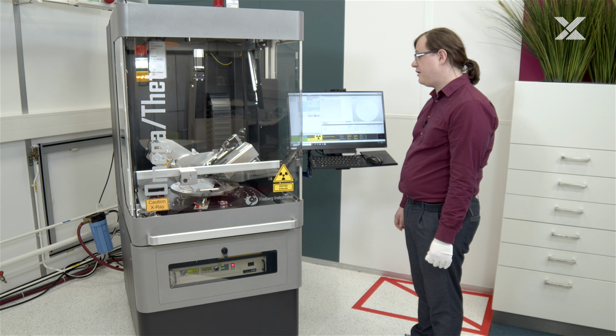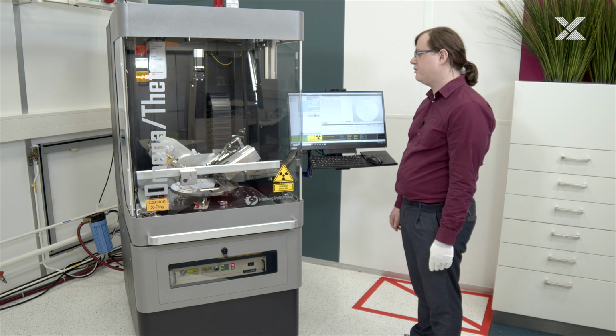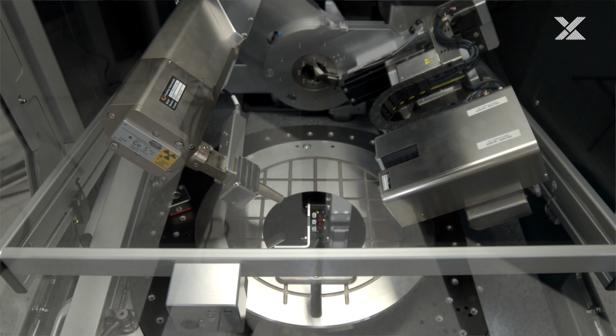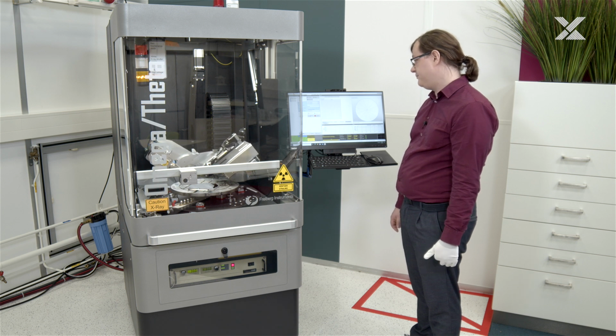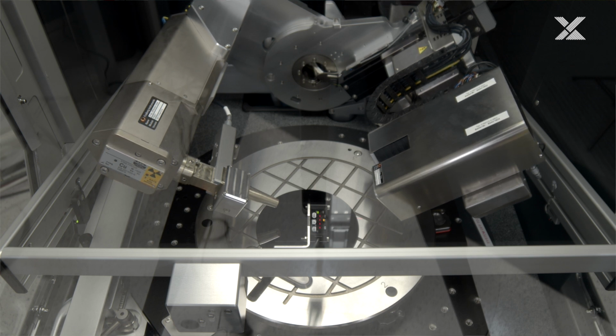this. I've now set it up to afterwards also automatically record a rocking curve once we have the tilt and tilt direction. So now it will turn the wafer accordingly, do the scan one time fast, just to make sure we actually have the peak in our scan range, and then repeat the scan slower.